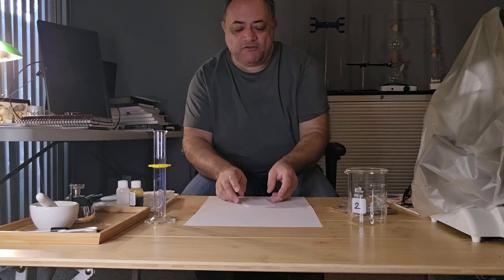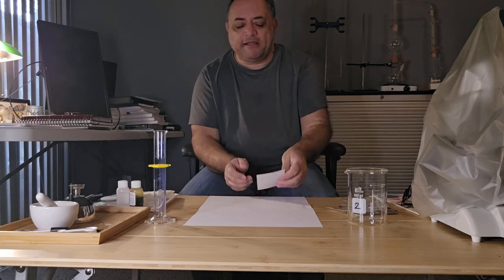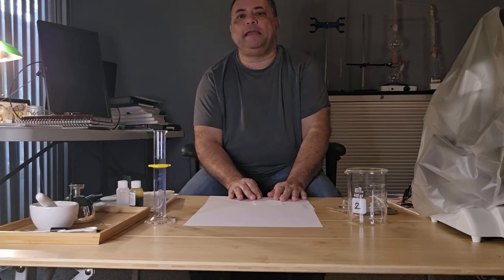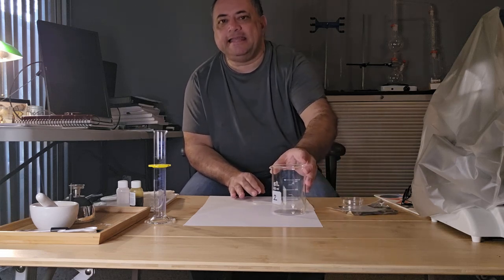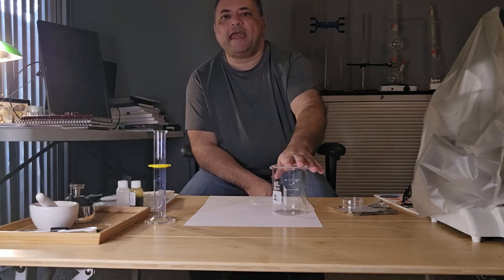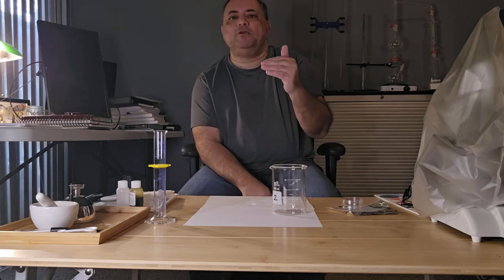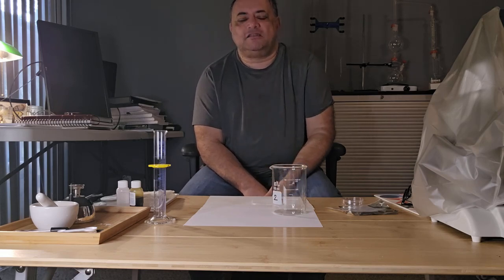In today's experiment, we've got our stationary phase, which is our filter paper. We're going to apply an extract of plant pigments onto the paper. We're then going to place the paper into our chromatography chamber, which will contain a chromatography solvent, which then moves up the paper. As it's moving up the paper, you will see the plant pigments start to separate.